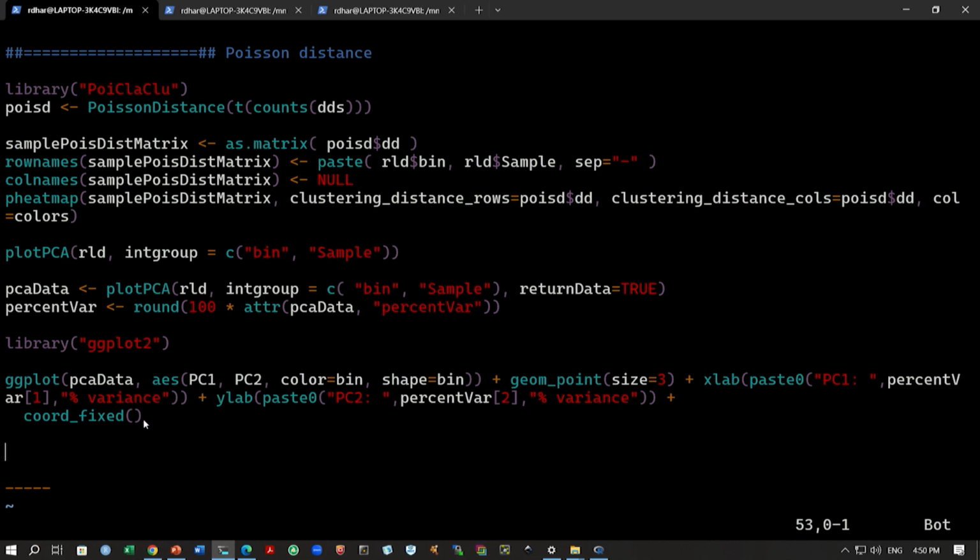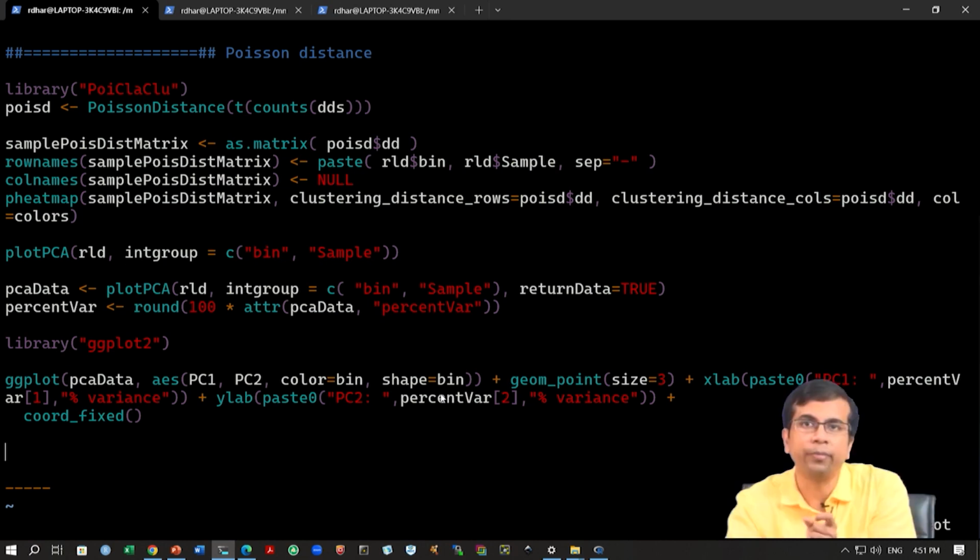So, if you are not familiar with ggplot, do not worry, you can look up the ggplot2 manual, and you will see how we can specify all these axes, the point size, etc. It is a bit different from what we have used before. For the plot function, inside plot we mention xlim equals c of something, ylim equals something, the x label, y label, everything inside the plot function, but ggplot is different.